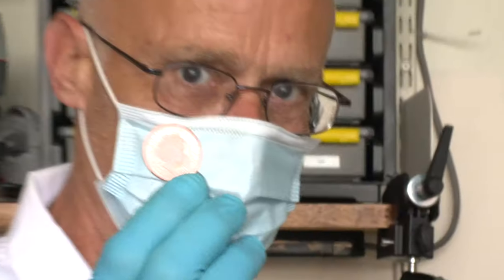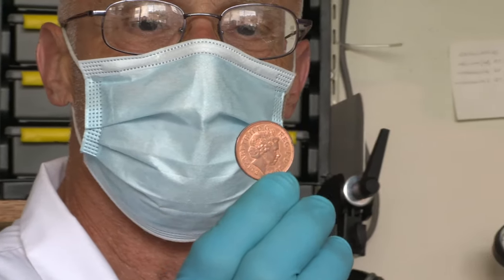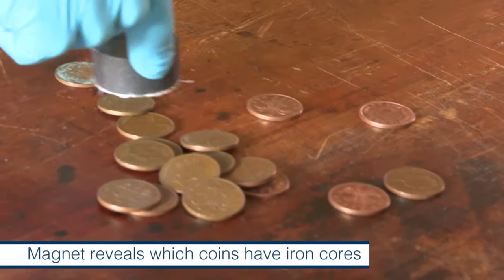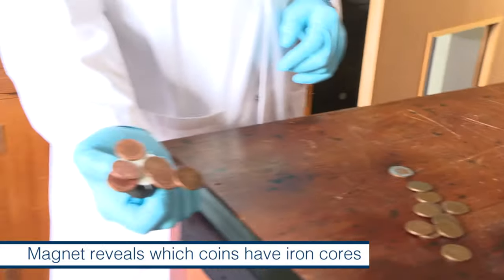Now, the third demonstration is based on the English two-pence coin, which most people call the 2p coin, which used to be made out of copper, and now, because copper has become much more expensive, is made out of iron with a coating of copper. I had the idea that we should try reacting a two-pence piece with concentrated nitric acid. You know we enjoy destroying coins, or at least reacting them chemically. The reason here is that copper dissolves in concentrated nitric acid. You've just seen it dissolving.